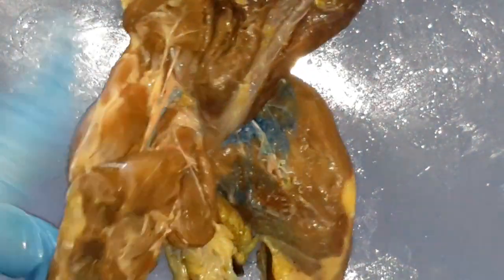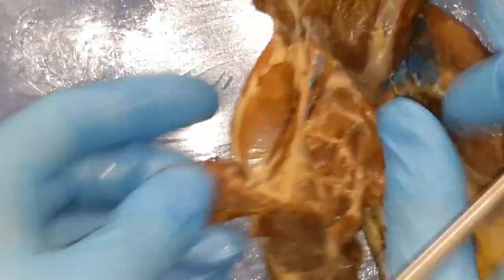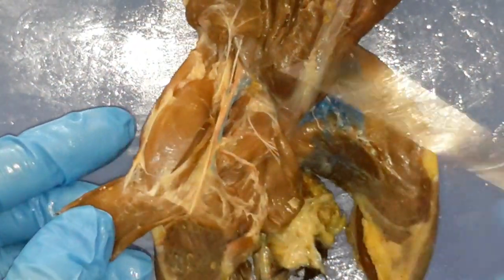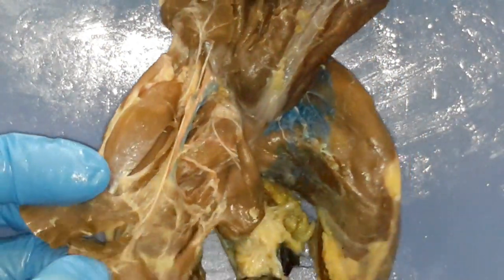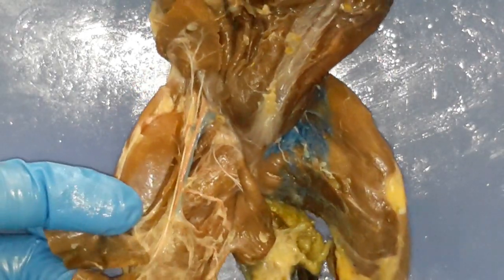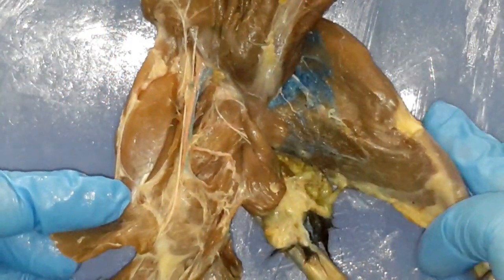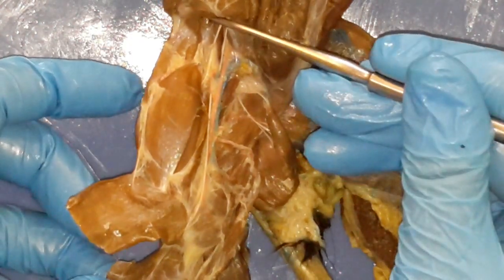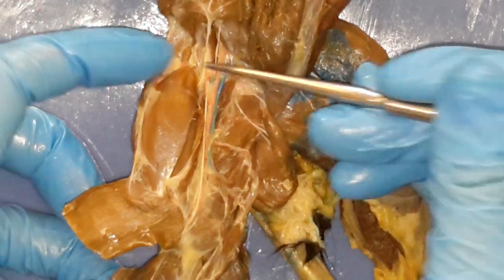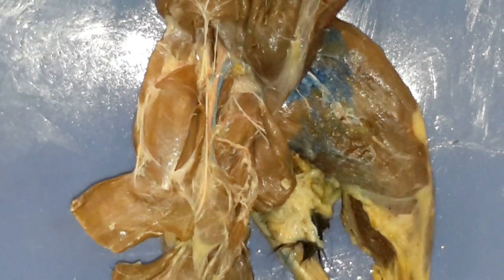Keep it clean, keep that connective tissue around the knee — you have a lot of muscles that do attach to it. So the only bisections that are happening in the leg at all on this side are going to be the sartorius and your gracilis. Everything else needs to stay intact — just separate and clean. And just remembering your iliopsoas group is way high, it's above where your femoral artery and nerve are, so it's up higher. It's a tough group of muscles.